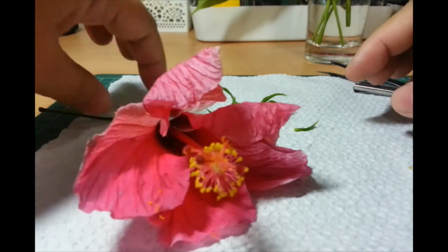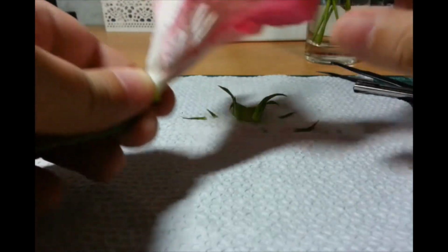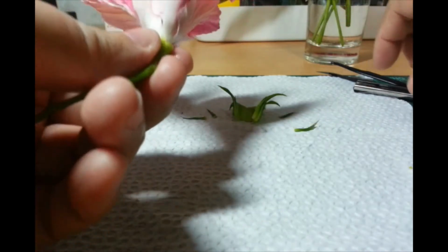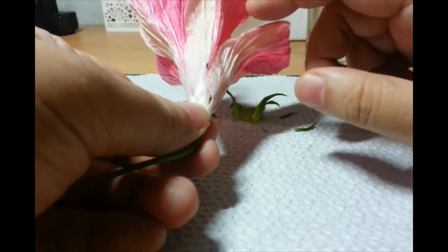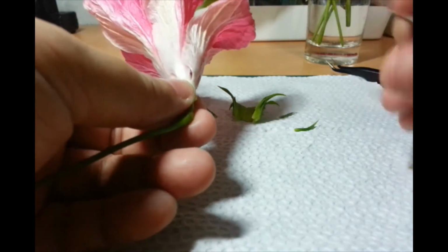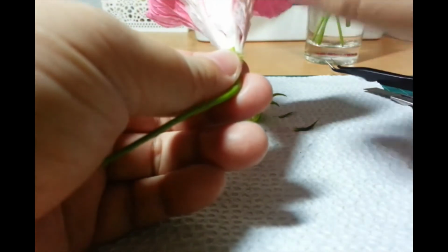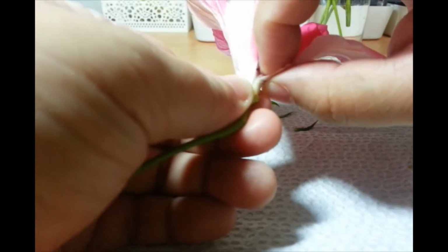Okay. So, natanggalan natin si bracts, si sepals. So, now, we have the petals. Okay? So, they also form a ring. So, collectively, the petals are called the corolla. So, hindi lang siya car. It actually is a flower part. Okay? So, collectively, the petals are called the corolla. So, let's see if we can try to remove it as a ring.